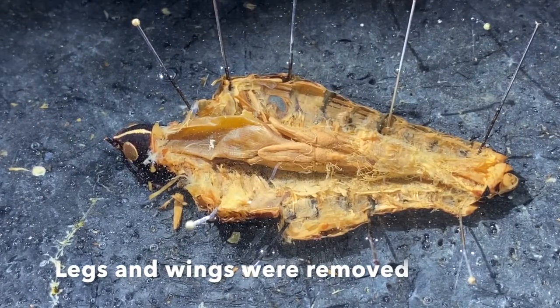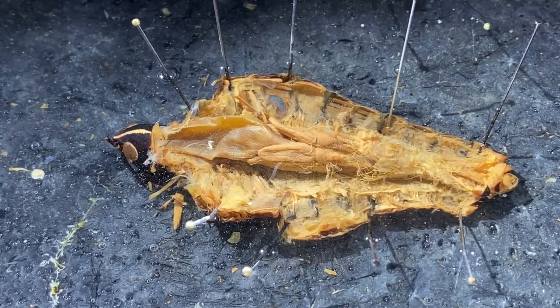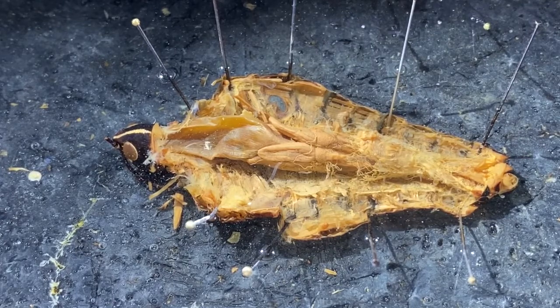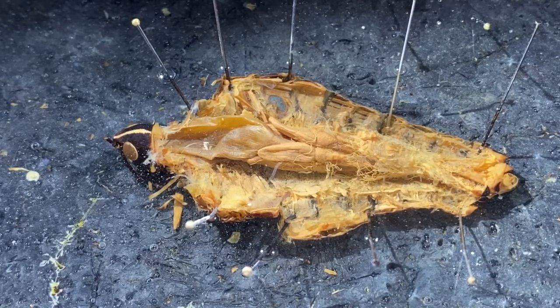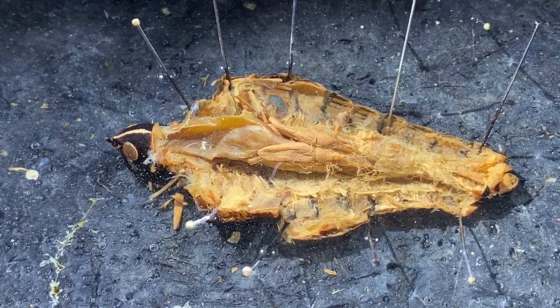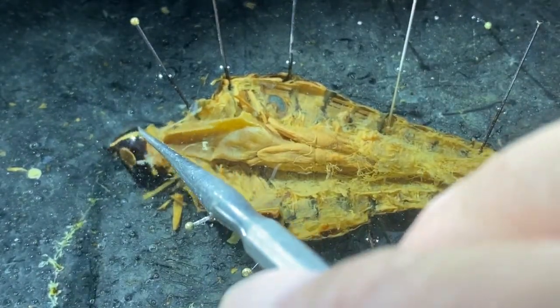All right, let's take a look at the internal anatomy of the lubber grasshopper, Romalea. There are different ways to open up grasshoppers. My preferred way is to do a longitudinal cut along the dorsal body wall and to pull the exoskeleton back in both directions so we have a dorsal view of the internal anatomy. Let's start up here at the anterior part of the region on your left-hand side of the screen. This is the head. You can see the compound eyes on either side.